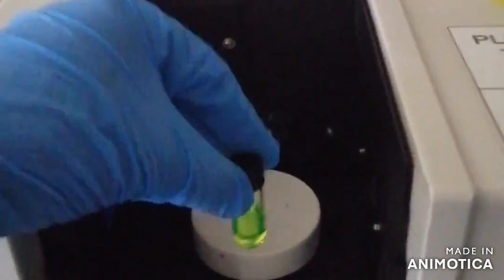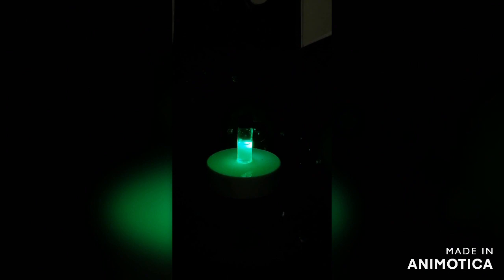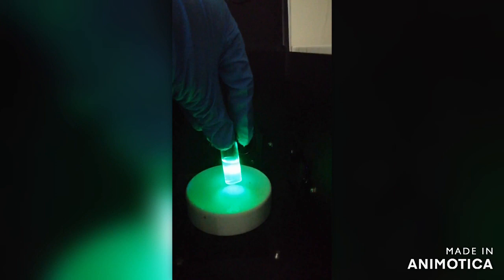These nanocrystals look extremely luminescent under the UV lamp. After washing the nanoparticles, we can see they are extremely bright with emission at 515 nanometers under the UV lamp. Moreover, the colloidal stability of these nanoparticle ink is extremely high and they have a sharp emission.